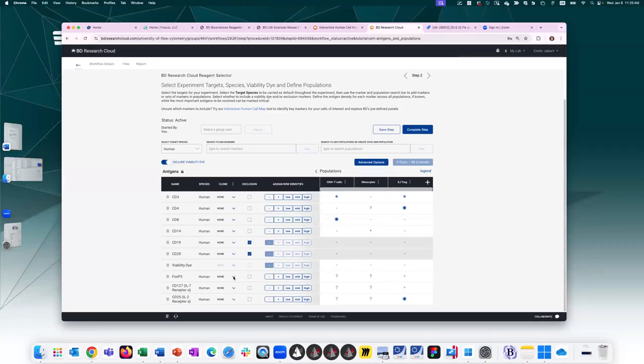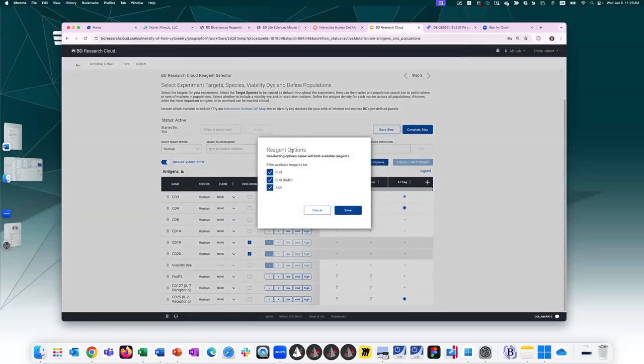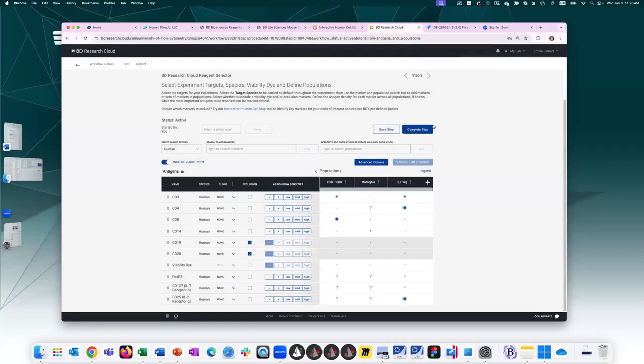So for FOXP3 here, if I wanted to restrict and only use one of these clones because it's my favorite one and I don't like how the other ones are working, you can make that selection at this point, and it will only show you what fluorochromes are available for that specific clone. The last option to highlight here is you can restrict which reagent type you move forward with. So right now we're not going to restrict anything. We're going to use all reagents. All right, so now that we've defined our populations of interest using this table and assigned antigen density, oh, FOXP3 here, I'll do negative for this, monocytes are all negative for this. Okay. So I'm going to move on to the next step.